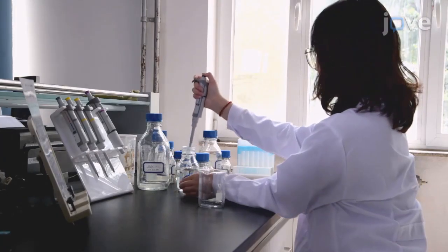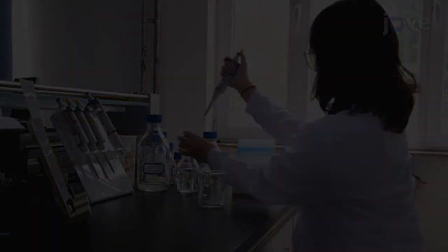Make fly food, if necessary, with yeast medium, artificial diet, or pure sucrose.